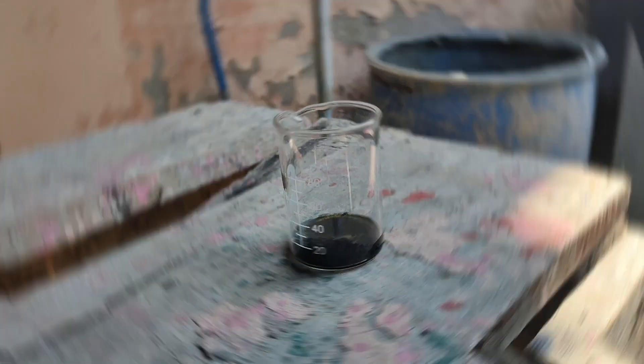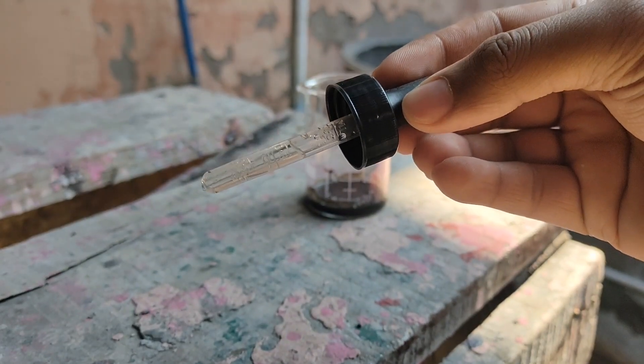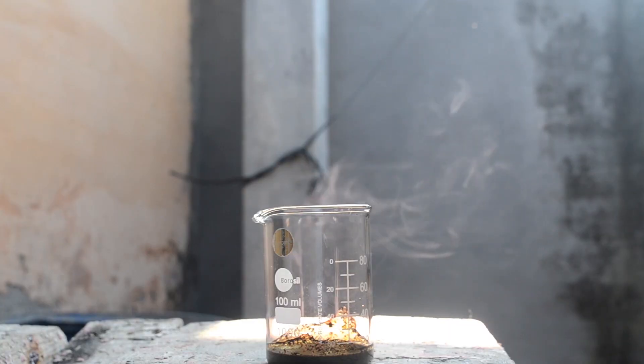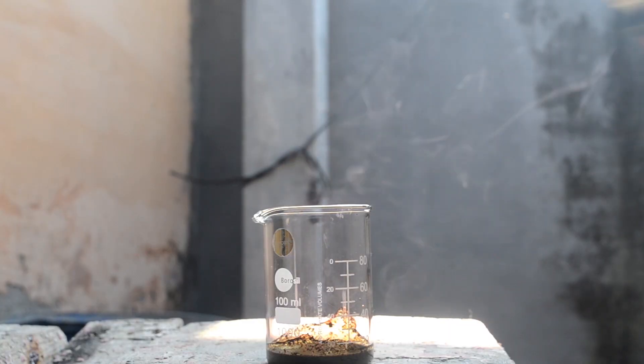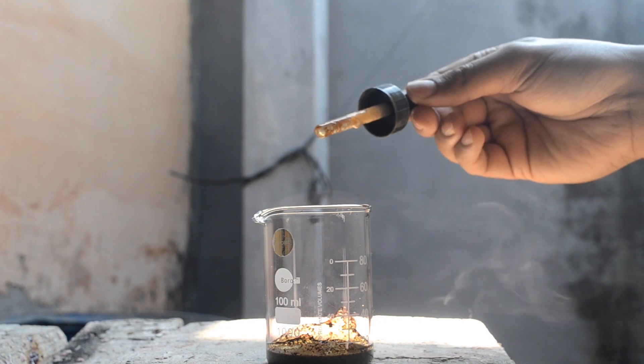Now we'll take a small amount of ethyl alcohol in a dropper. Let's see what will happen if I drop this alcohol into the mixture.